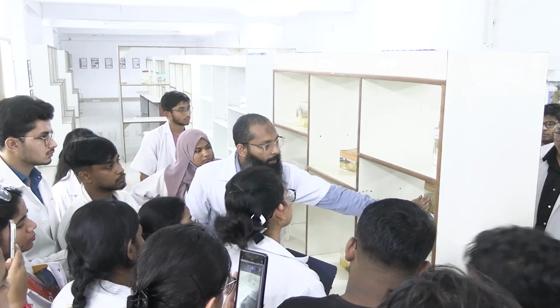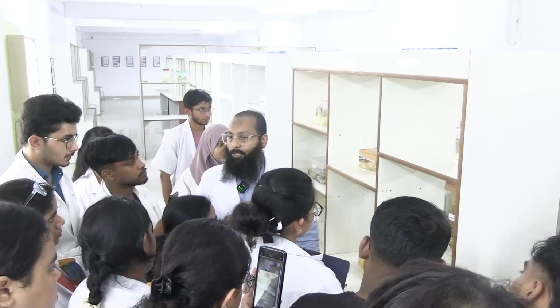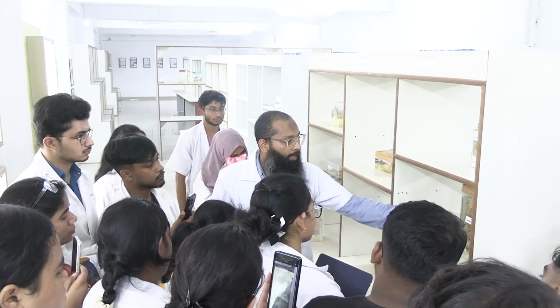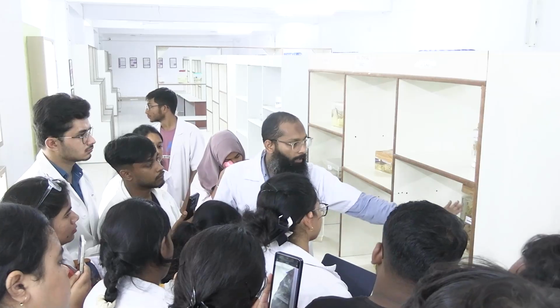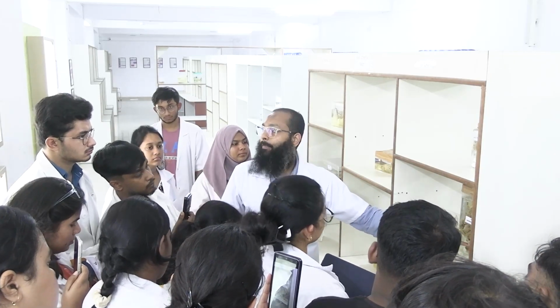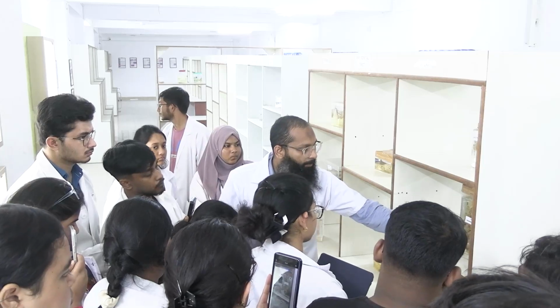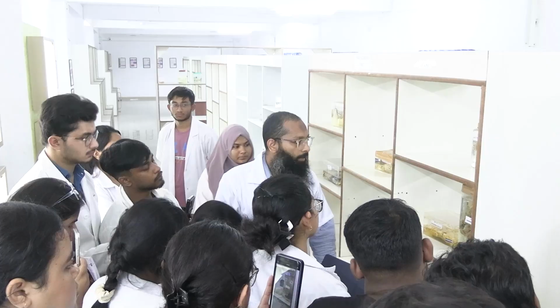So if you look at the normal breast, the most predominant thing will be the adipose tissue, and in between there will be admixed TDLU, okay. TDLU is not visible by naked eyes. So the presence of adipose tissue, that is a normal breast, but the presence of any mass, whitish area or blackish area or reddish area, these things are abnormal, okay, fine. So this whitish area which is present over here, that is a mass, and that is definitely abnormal.